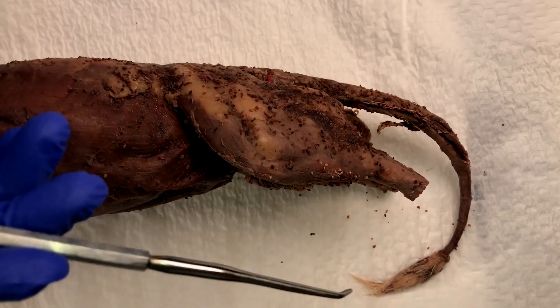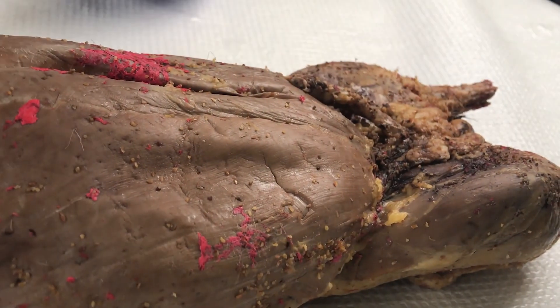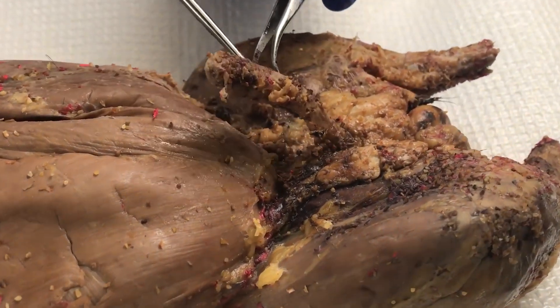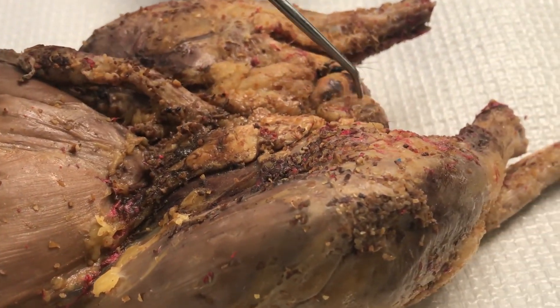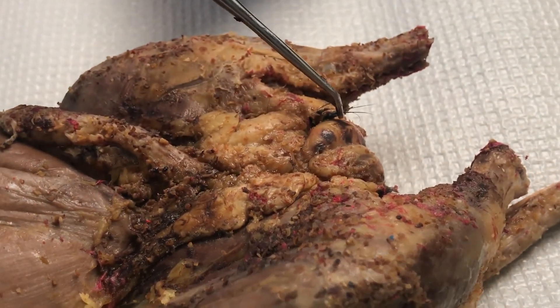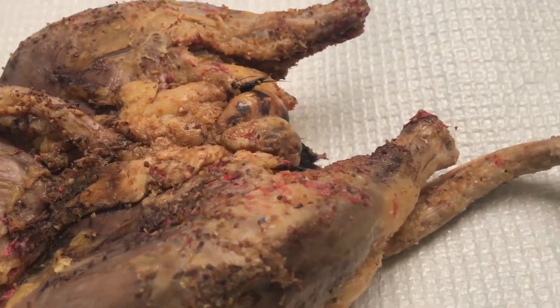To distinguish between the sexes, we also look for external features. We'll start by looking at a male. Here we have its penis, behind which sit its testes. Although not visible here, the anus does sit behind these testes.